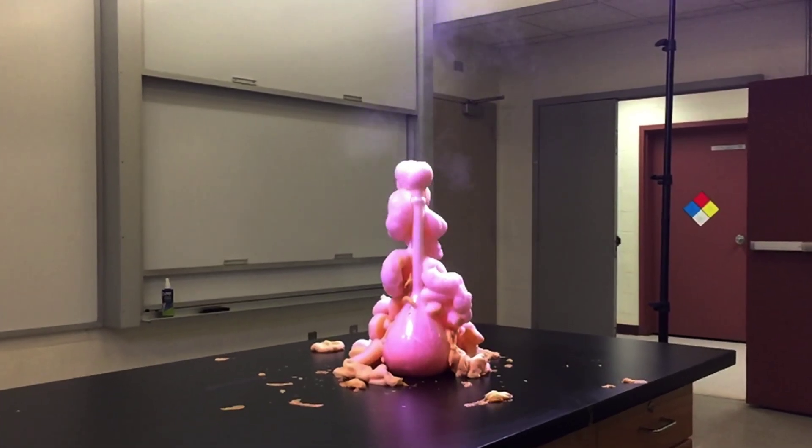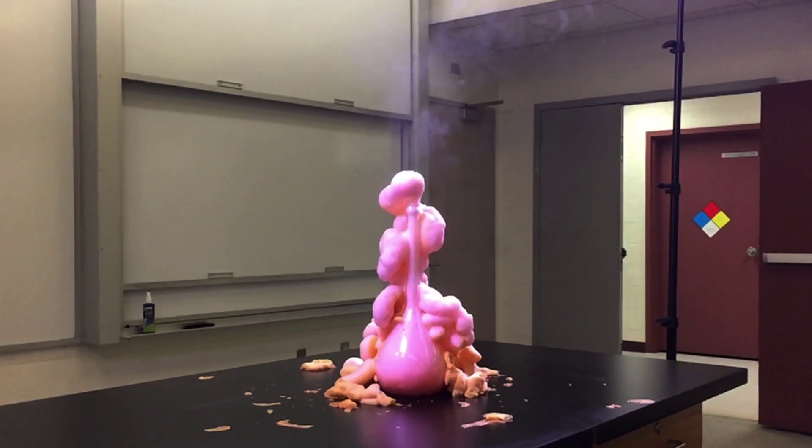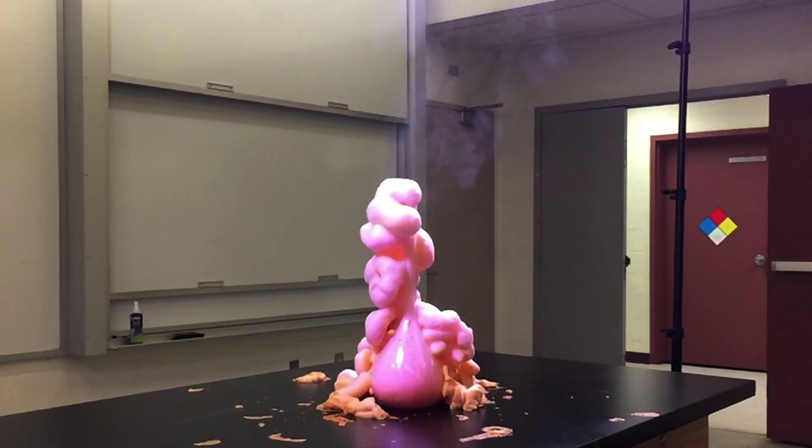That steam expands quickly, mixes with the soap and the oxygen gas, and all of this hot air gets shot out of the top of the flask together in a hot, foamy mess.